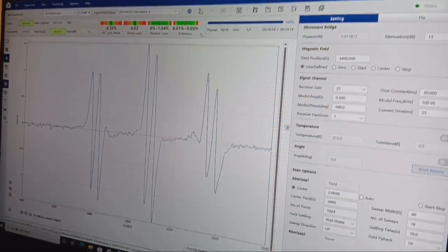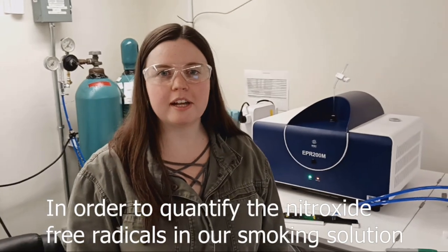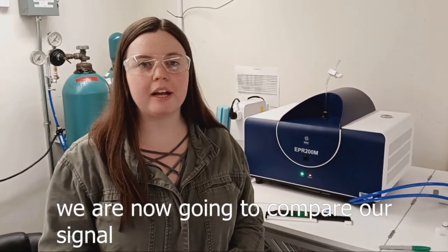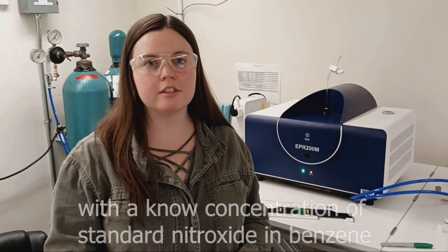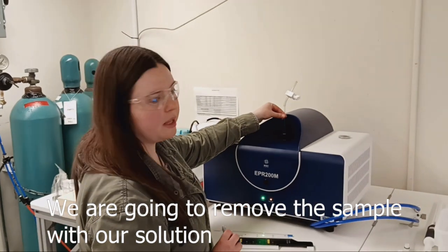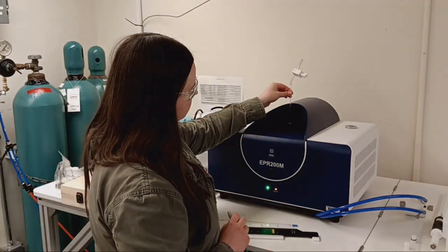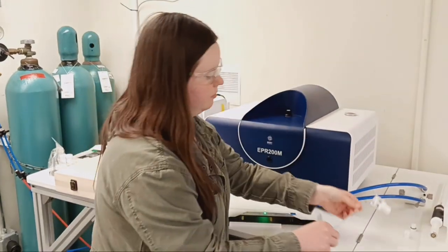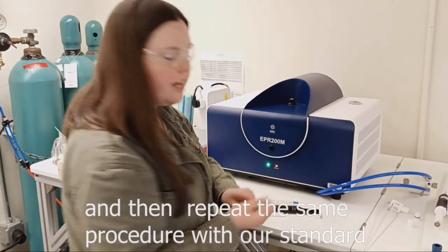Now, after all scans, in order to quantify the nitroxide free radicals in our smoking simulation, we are now going to compare our signal with the known concentration of a standard nitroxide in benzene. We are going to remove the sample with our solution, and then repeat the same procedure with our standard.